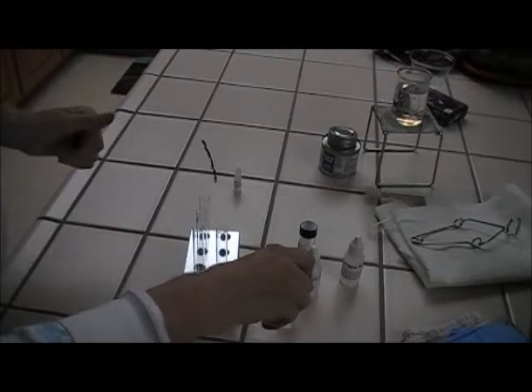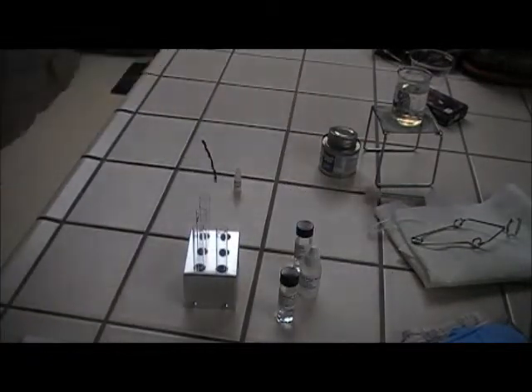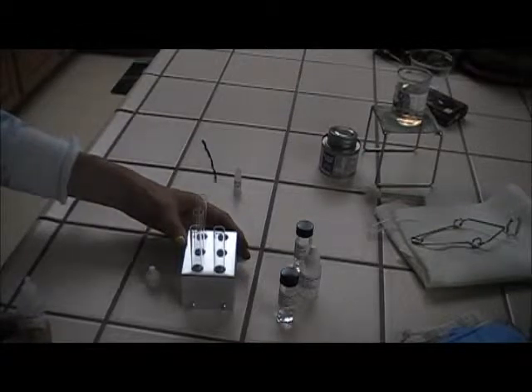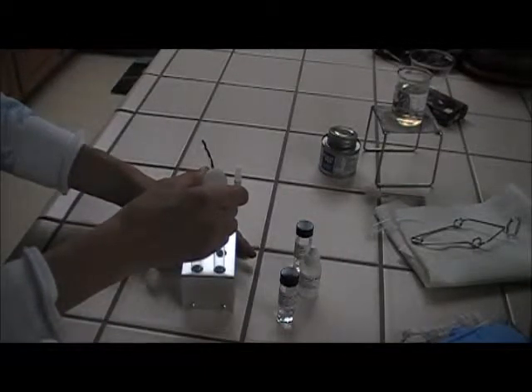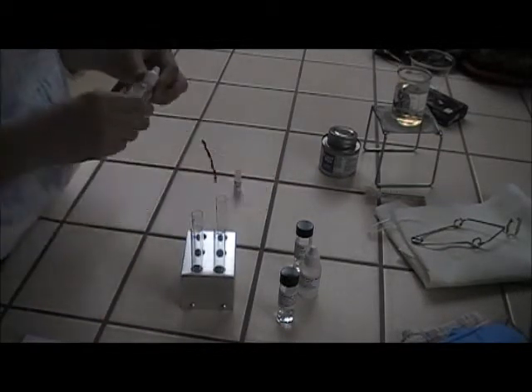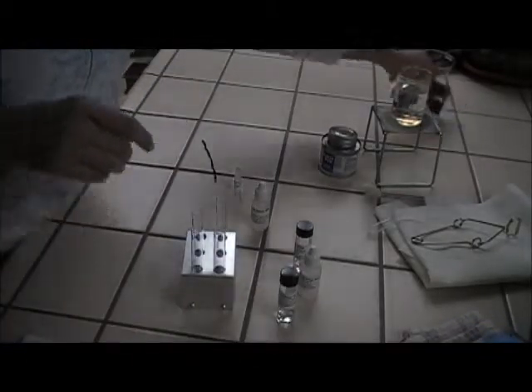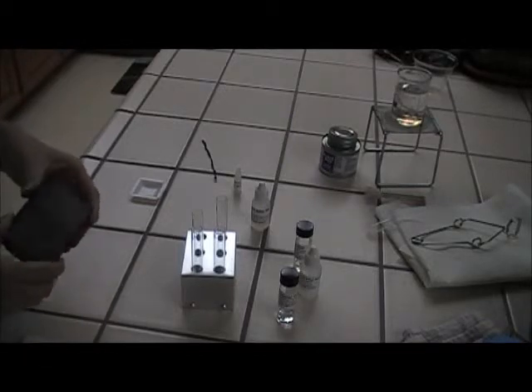All right. It also tells me to add 2 drops of sulfuric acid to each test tube. Here's my sulfuric acid, if you can read that. And again, I will be only placing it into test tube 5 and 6. Back, gently agitate. All right, and now I'm going to weigh out 0.2 grams of salicylic acid.